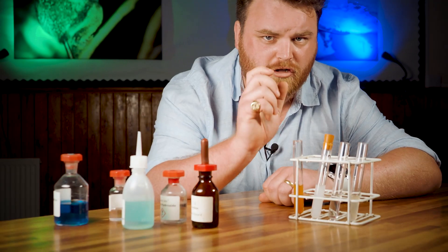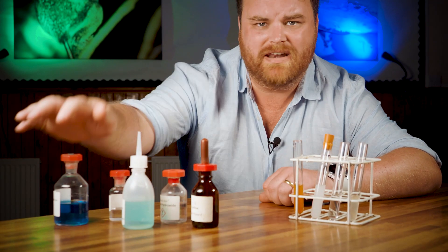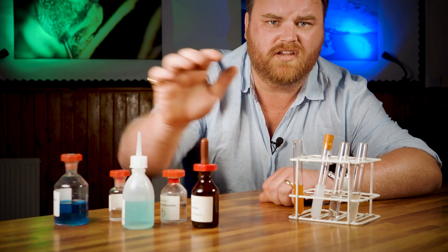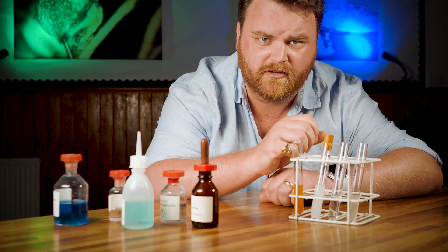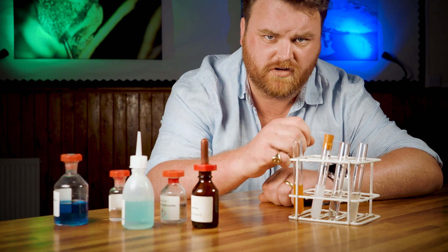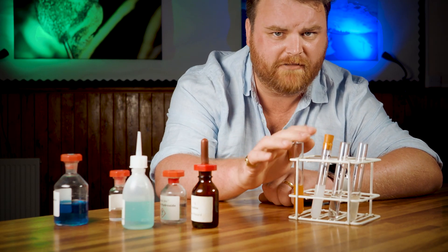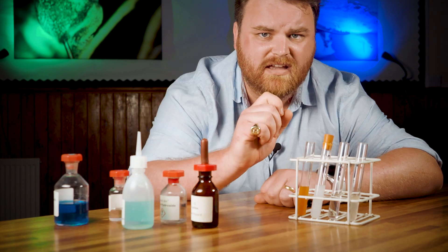And last but not least, it's food tests — four tests to learn about. First, glucose: the Benedict's test. Add Benedict's solution to your sample and heat it in a water bath at about 90 degrees. It'll turn green at low concentrations and you get a brick red precipitate at higher ones.